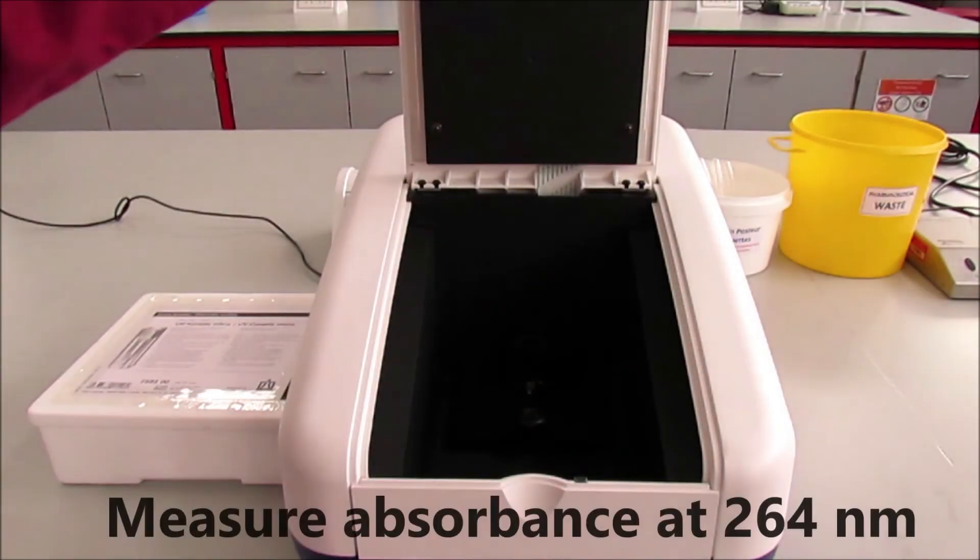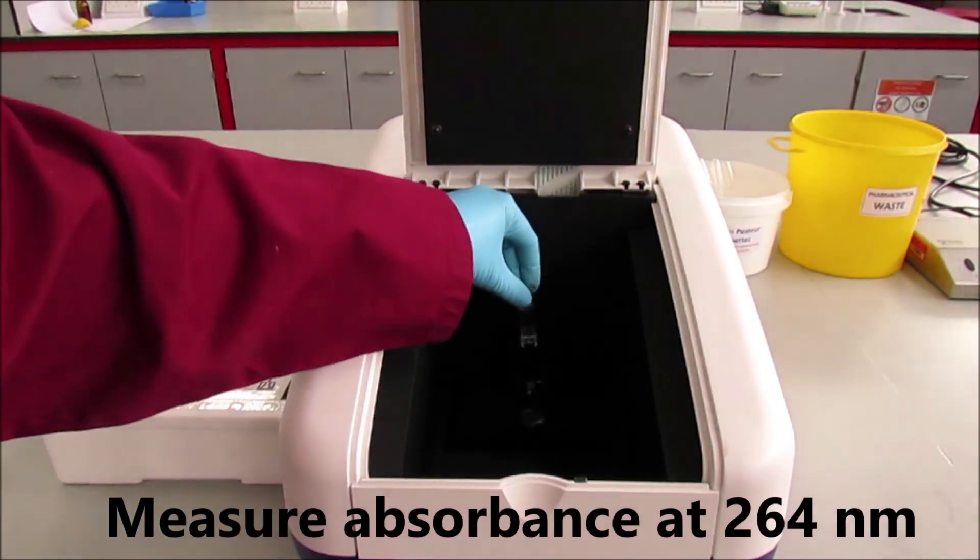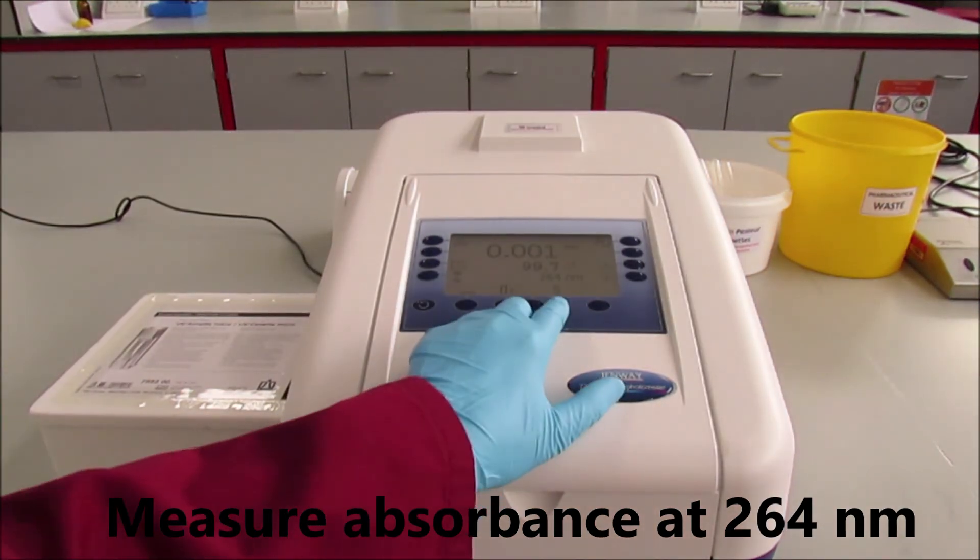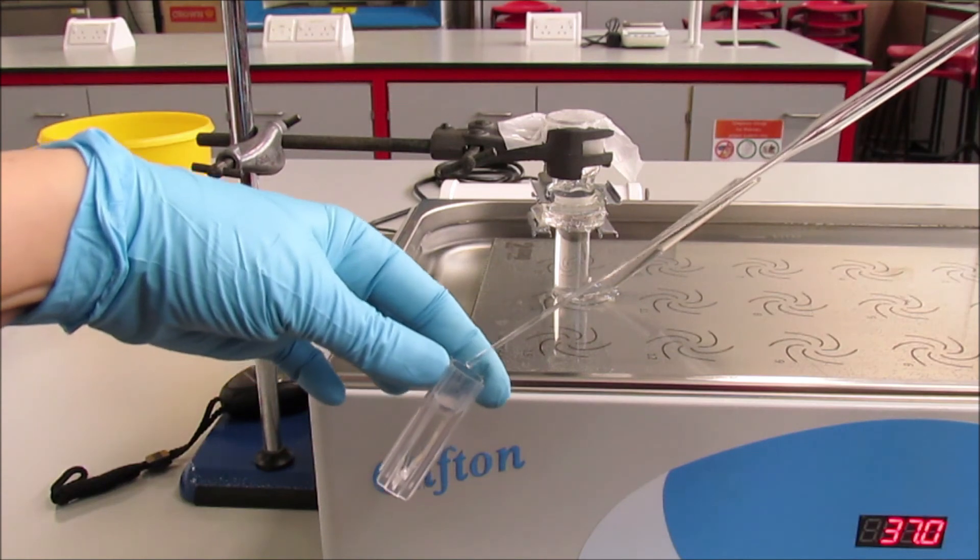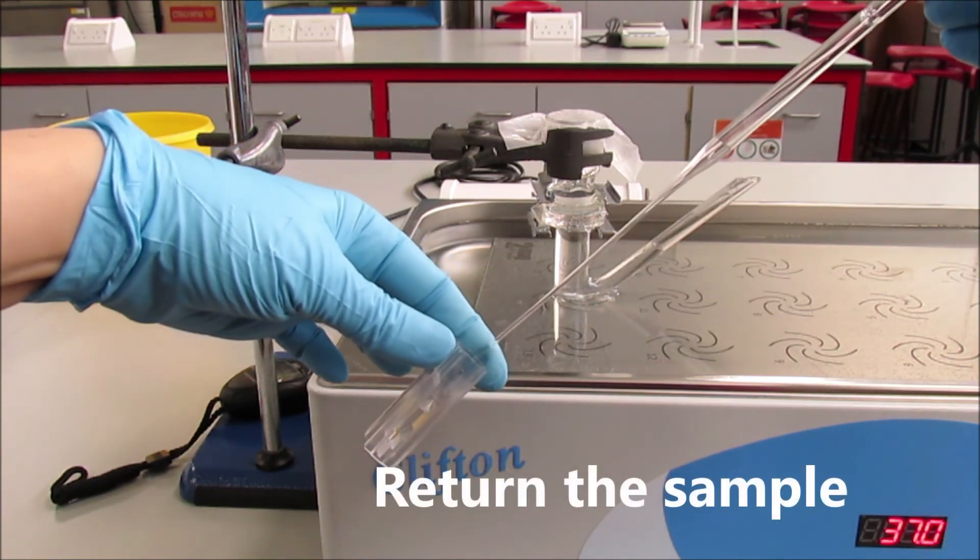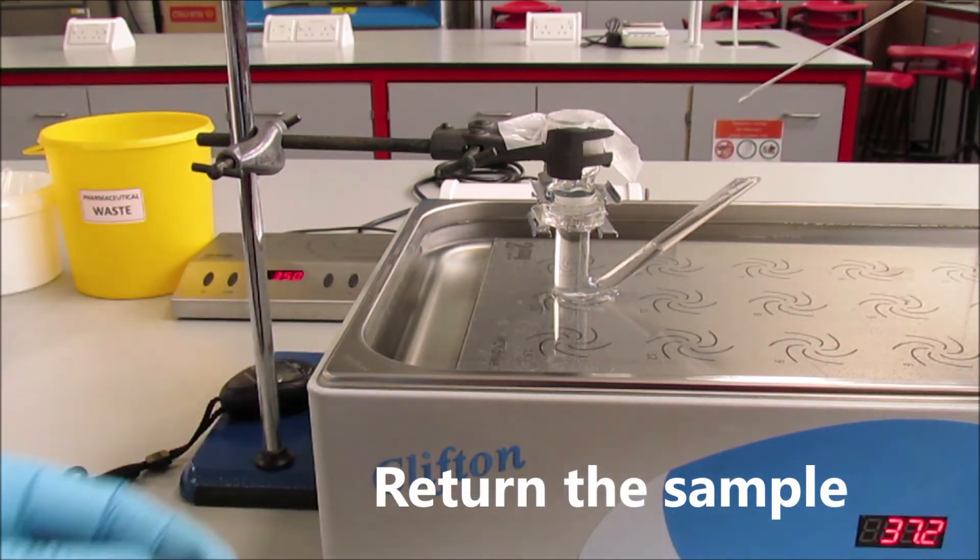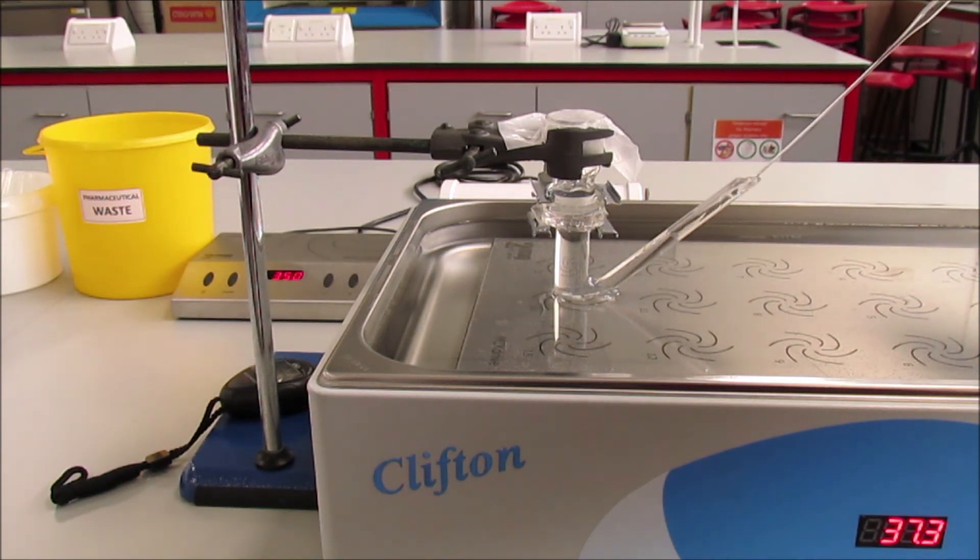Now inserting the cuvette into the spectrophotometer, press the reading button, then record the absorbance value. Then return this amount of sample back to the diffusion cell.